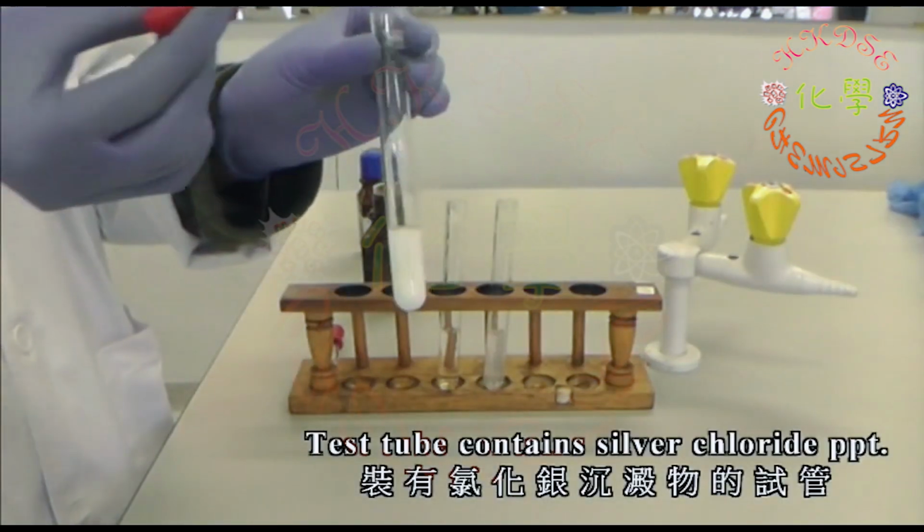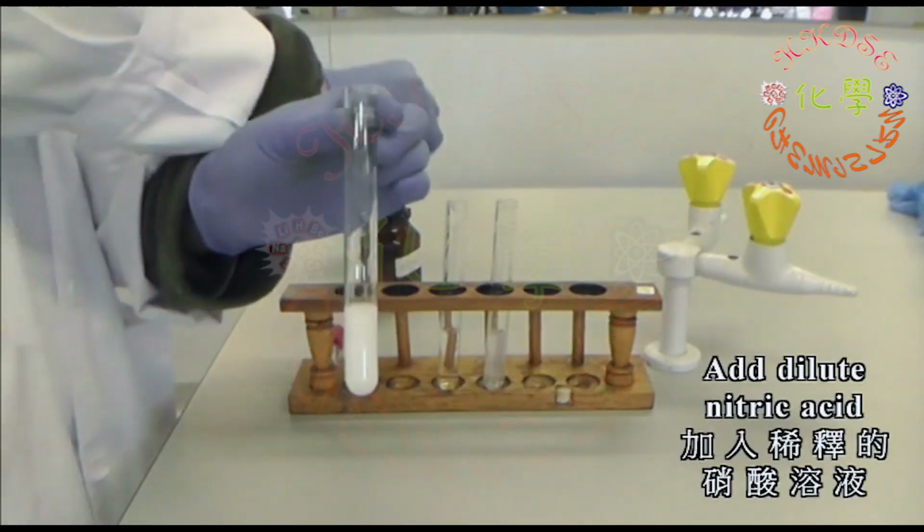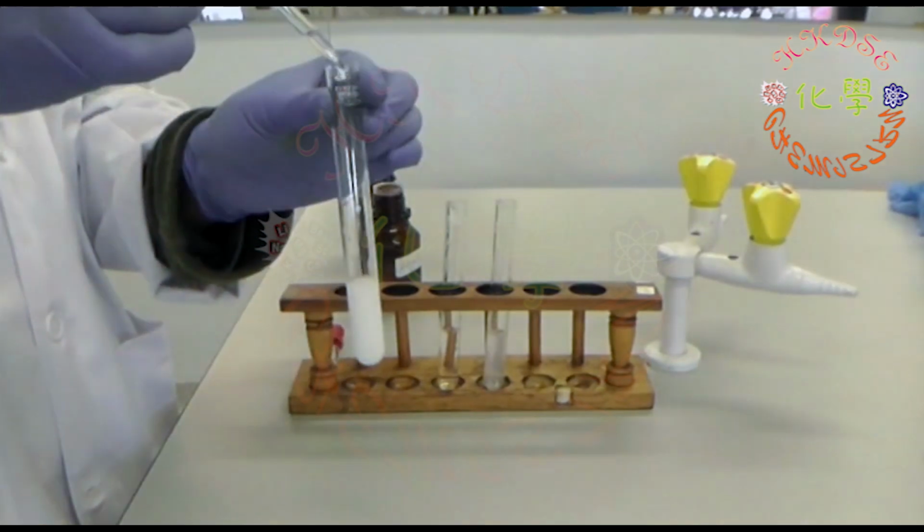And finally the test tube containing silver chloride precipitate, when added with dilute nitric acid solution, the solution remains with milky white precipitate.